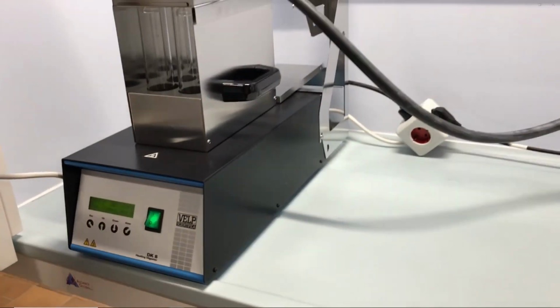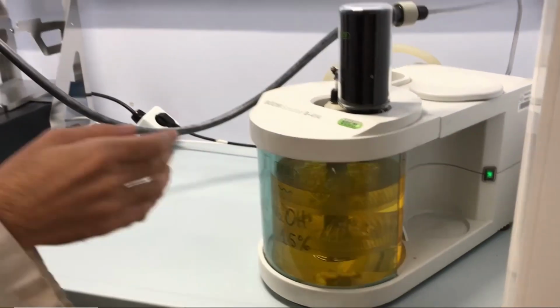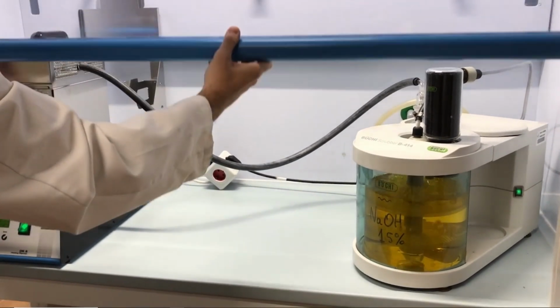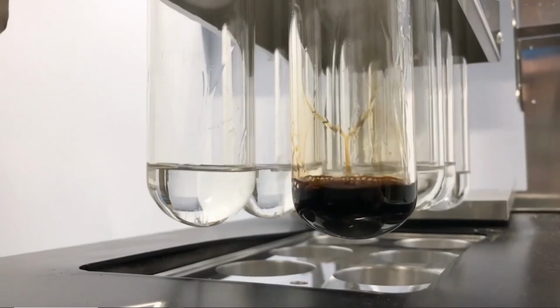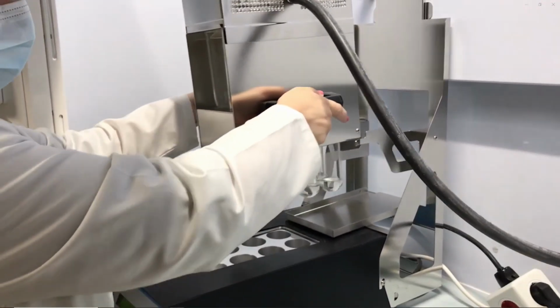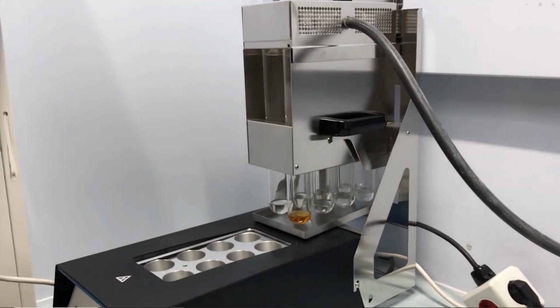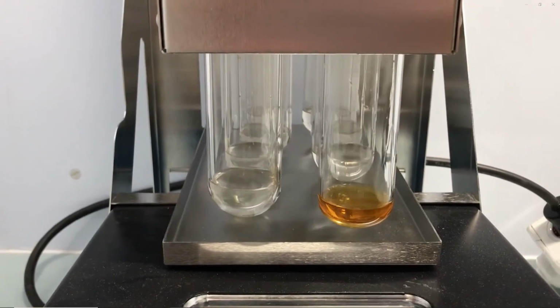The resulting fumes from the process are collected through the upper module and neutralized using a 15% sodium hydroxide solution. During this step, the organic matter is carbonized and turned into a clear yellow liquid. At this moment, the digestion module is removed from the digestion unit, separating the Kjeldahl flask from the rest of the equipment to let them cool down.